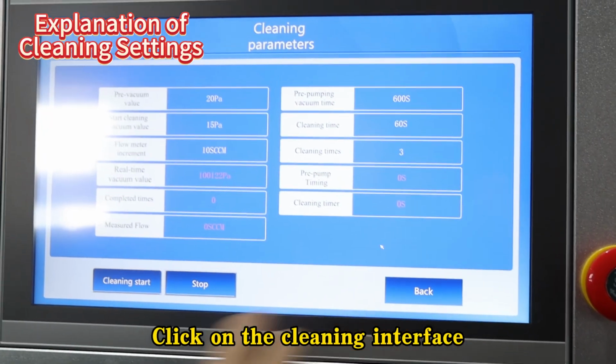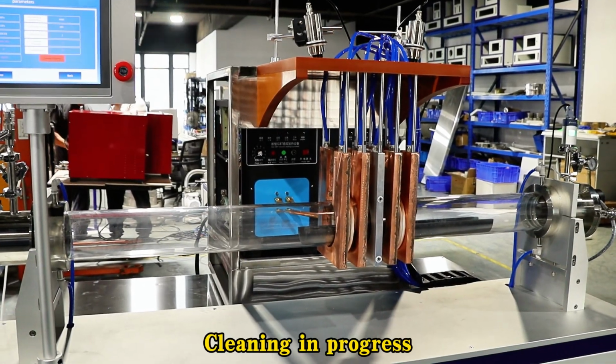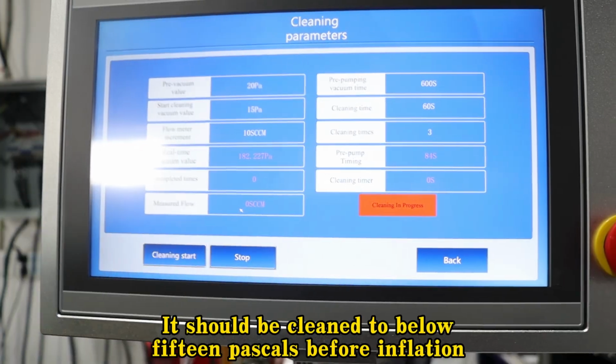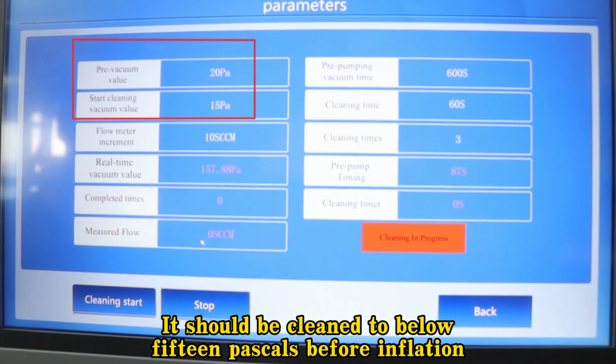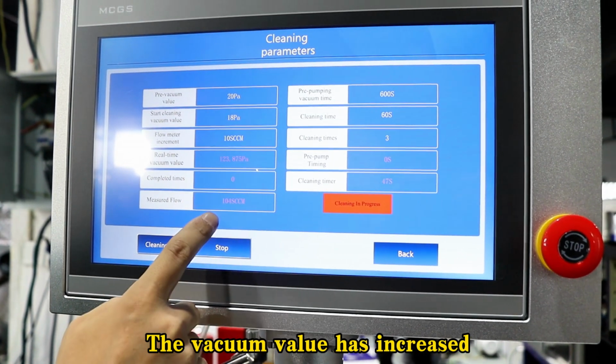Click on the cleaning interface. Click Start. Cleaning in progress. It should be cleaned to below 15 pascals before inflation. The vacuum value has increased.